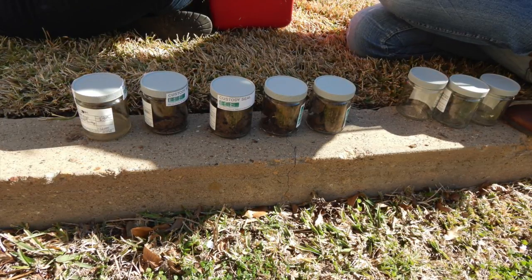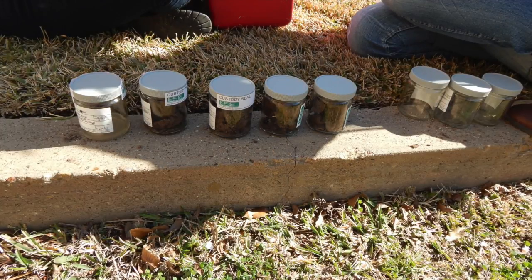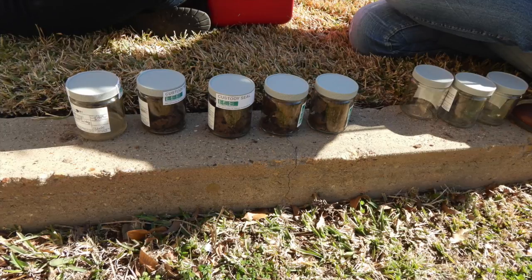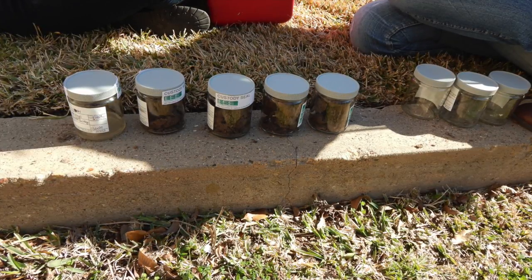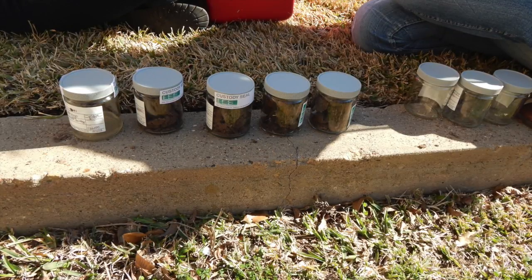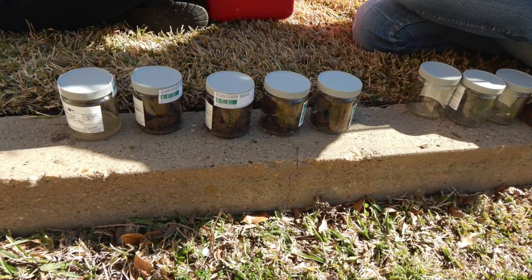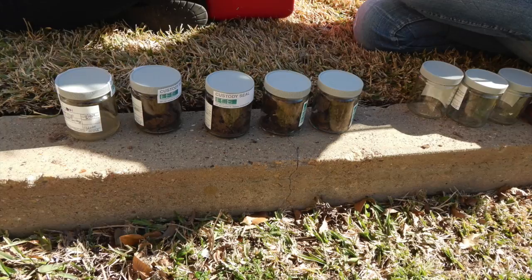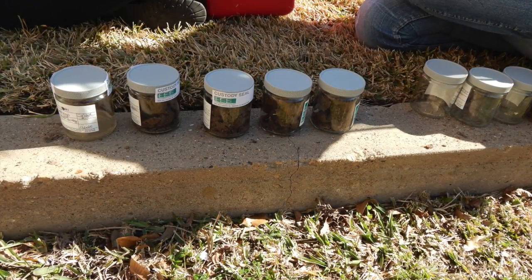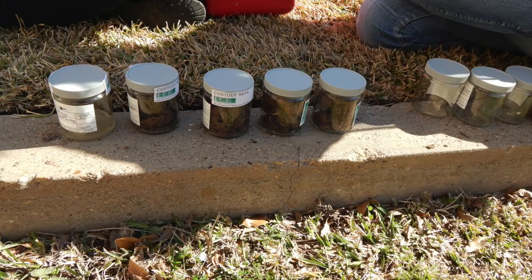When working with potentially hazardous materials, follow U.S. EPA, OSHA, and corporate health and safety procedures in addition to the procedures specified in the site-specific health and safety plan. Chemical preservation of solids is not generally recommended and was not used in this demonstration. Samples should, however, be cooled and protected from sunlight to minimize any potential reaction. Store the samples in an ice cooler with an ice pack.